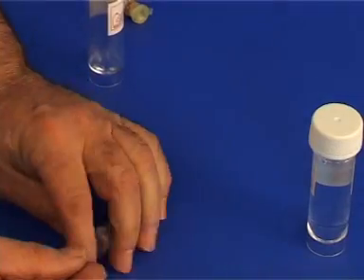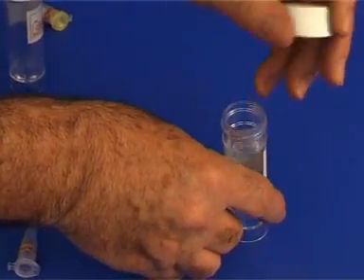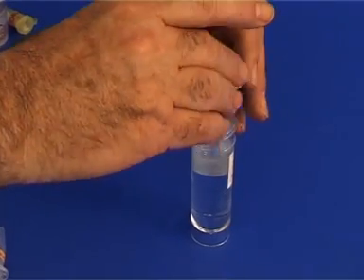To perform this experiment a different way, uncap a container and place a sodium acetate crystal in the solution.